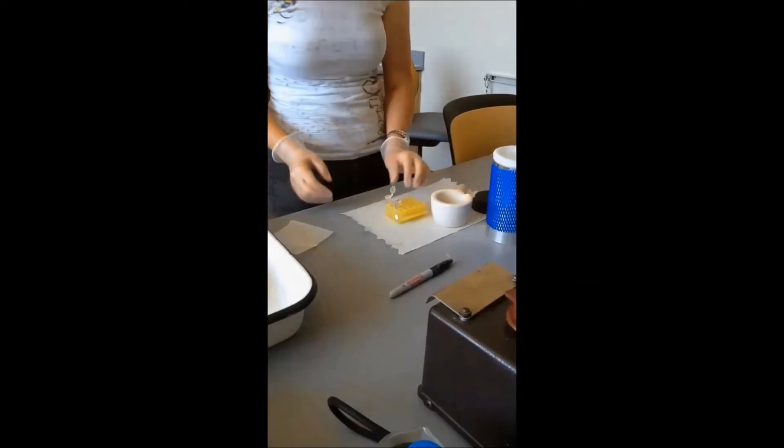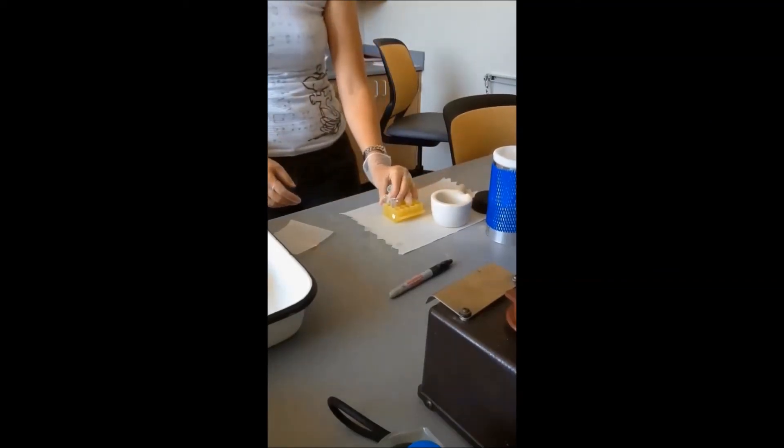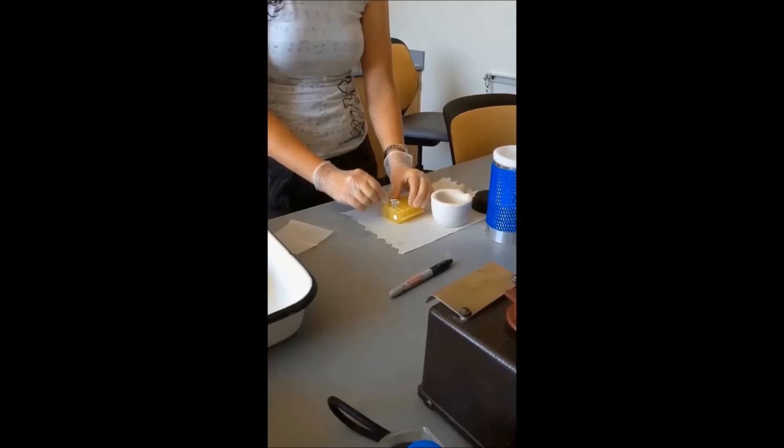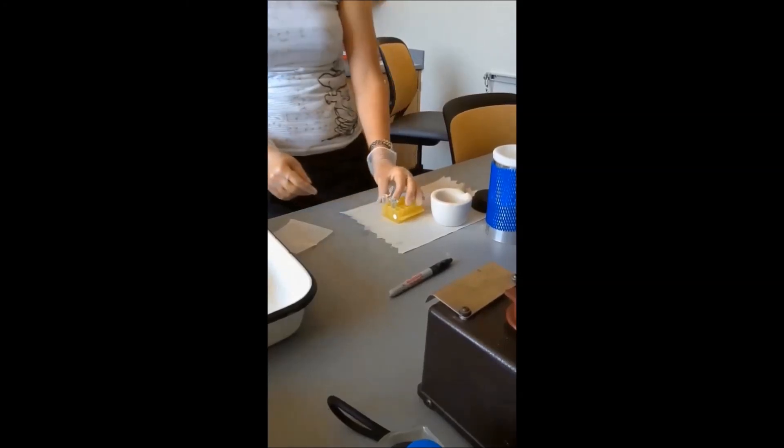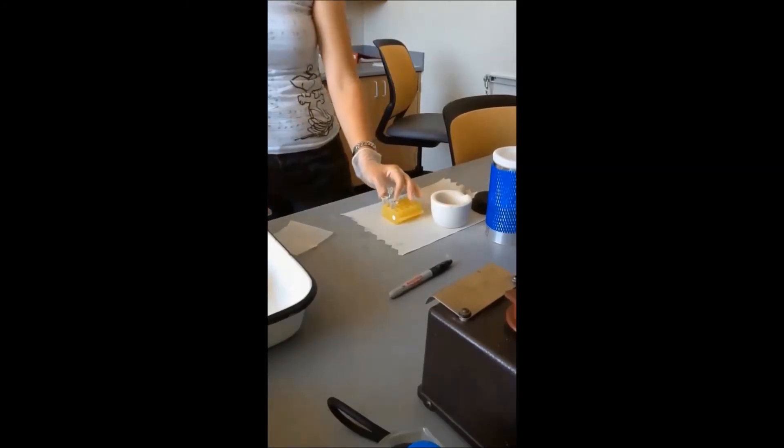And that's all of the sample. And then we're just going to allow this to stay open for a little bit while all liquid nitrogen evaporates and it's allowed to warm just a little bit, because it's really cold right now.